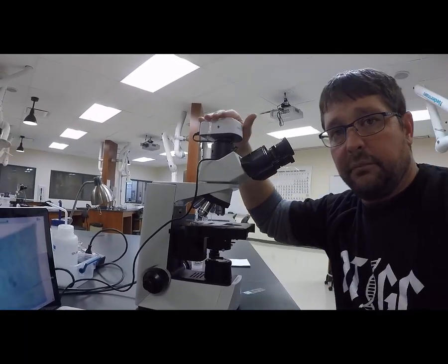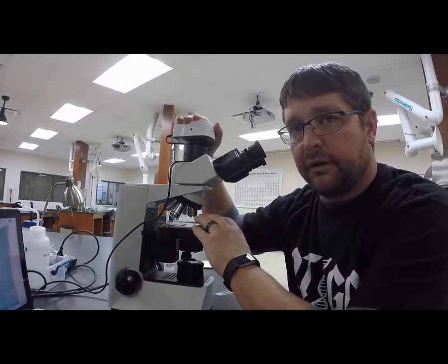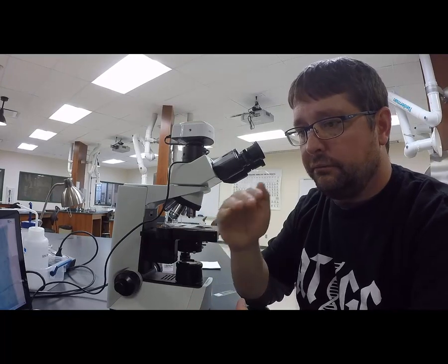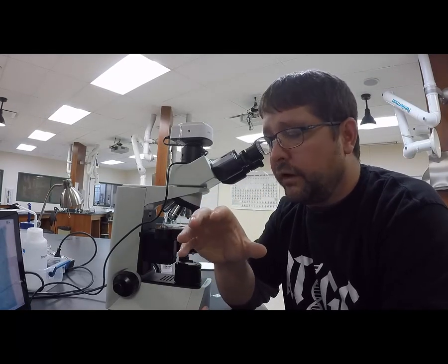All right. So now we're going to look at the microanatomy of a leaf. This is the setup I'm going to work with. You can see I have a compound light microscope sitting here. I have a leaf epidermis slide on it, epidermis being the top layer and the bottom layer. This one happens to be the bottom layer of the leaf because we're going to be looking at stomata.